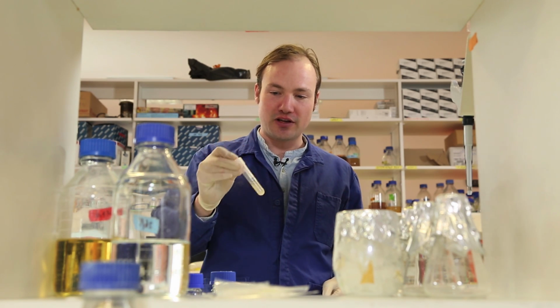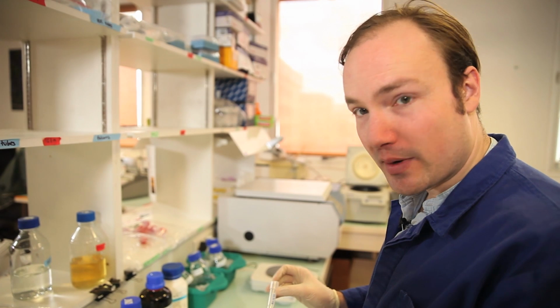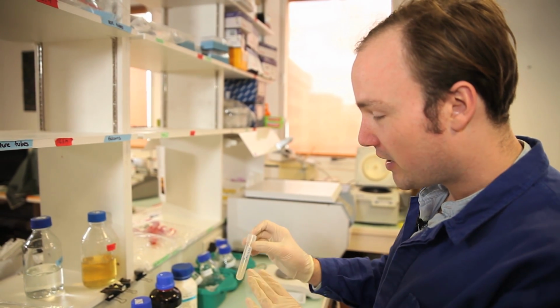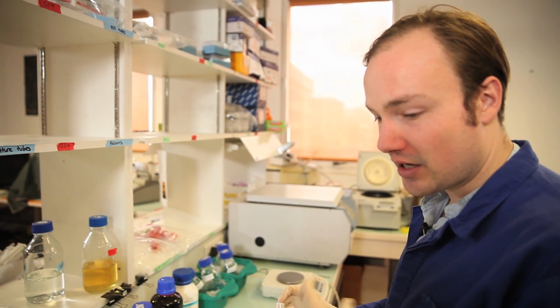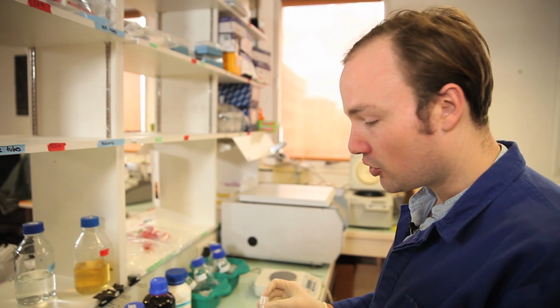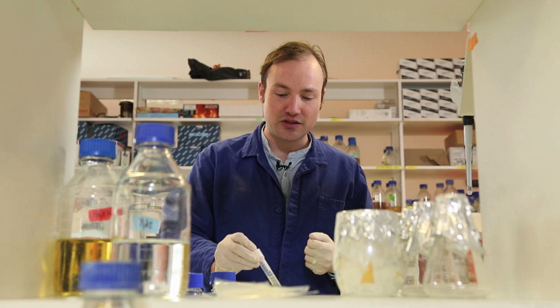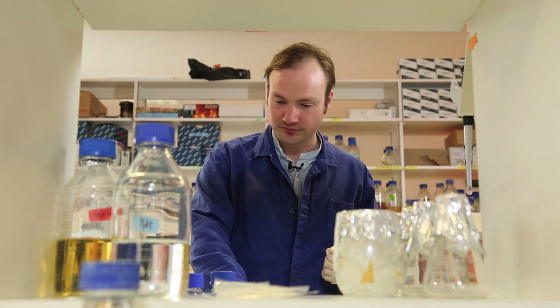Okay, so it's 8 to 12 hours later, and my culture of E. coli is nicely saturated. So the next morning, when you're ready to prepare your competent cells, you take these cells and dilute them by a factor of 200 into a fresh 50 ml culture. We always want to make competent cells using freshly growing log phase E. coli because they're the healthiest and they'll be the most competent.